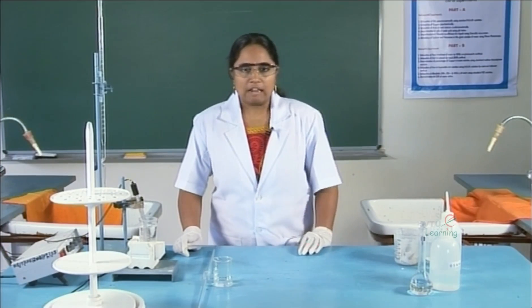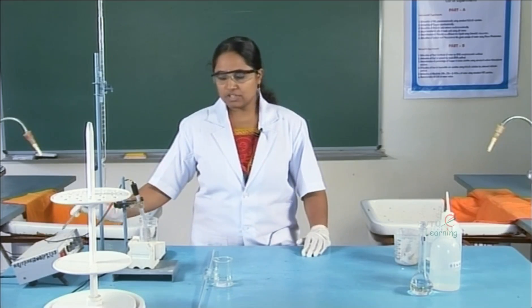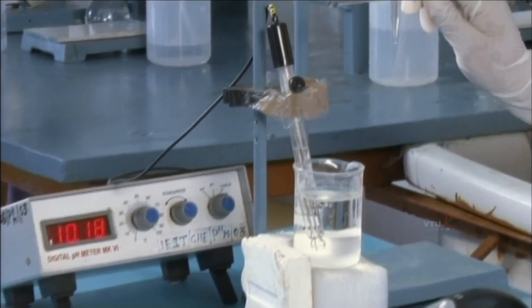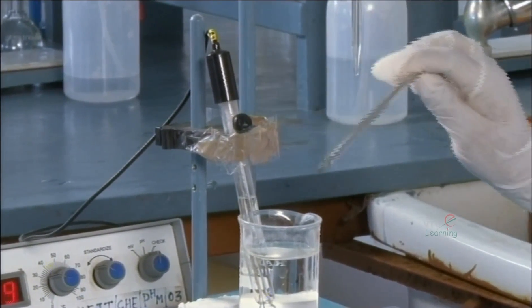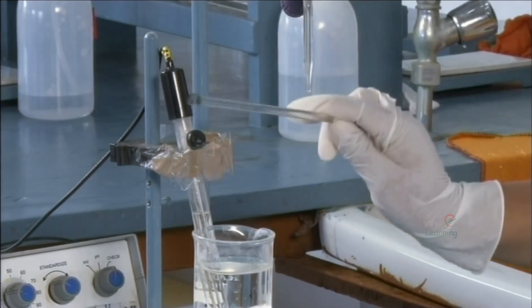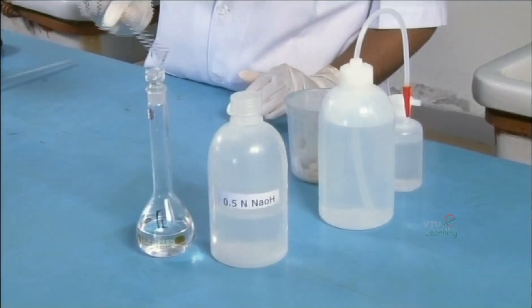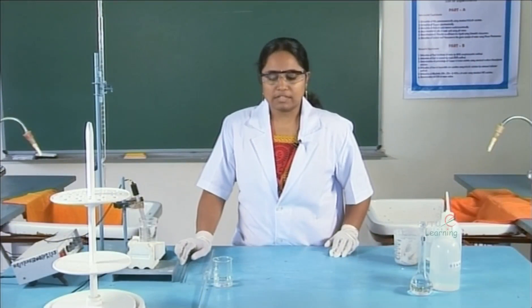For this experiment, we have taken acetic acid as the weak acid. The instrument used is a digital potentiometer. Where there is a provision for determining pH, it is also called a pH meter. The electrode assembly used consists of a calomel electrode and a glass electrode, combined as a pH cell. The reagents required are acetic acid solution as the sample weak acid and standard NaOH solution as the base.